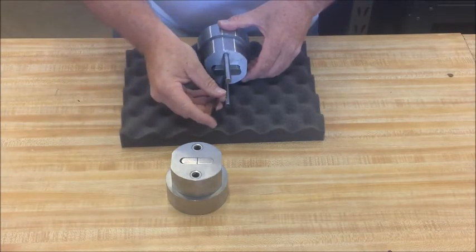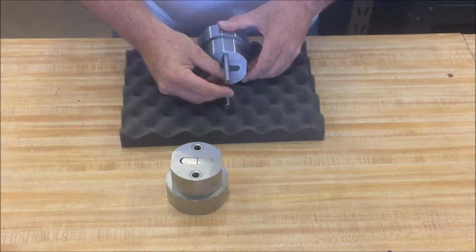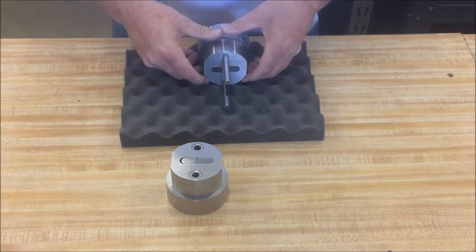Place the specimen into the grip faces, press down gently until the grip faces come in contact with the specimen.